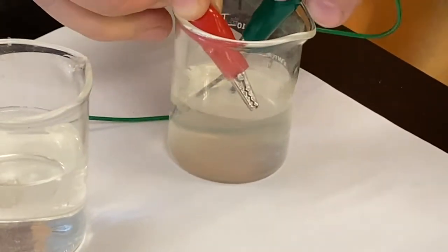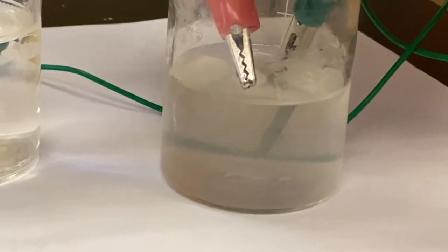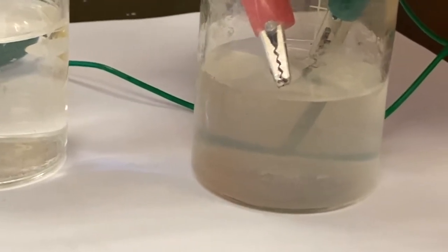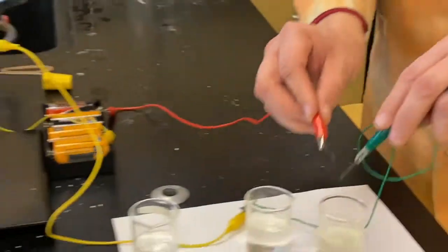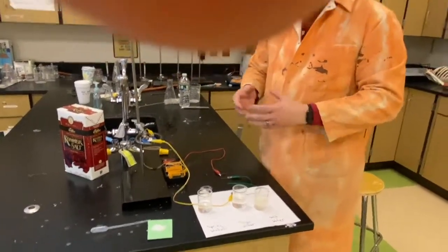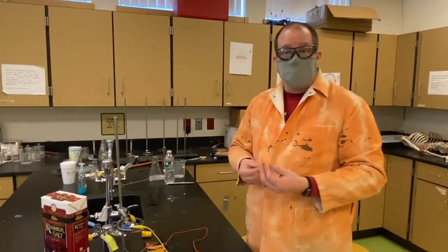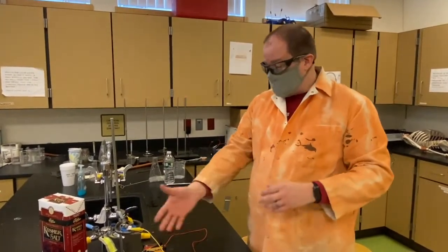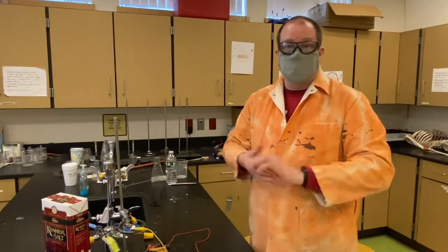And we can further see when you look down into here, because we are using some direct current, we're actually breaking apart a little bit of the water molecules in there. We got a little electrolysis going on. That's why there's bubbles coming out of our red lead here. So there you go. This is just a highlight for you, the property of ionic versus molecular, meaning ionic compounds in solution conduct the flow of electrons. Molecular compounds typically do not.